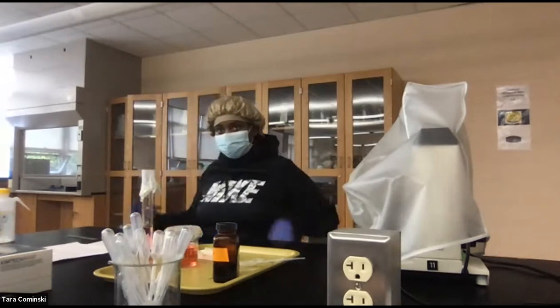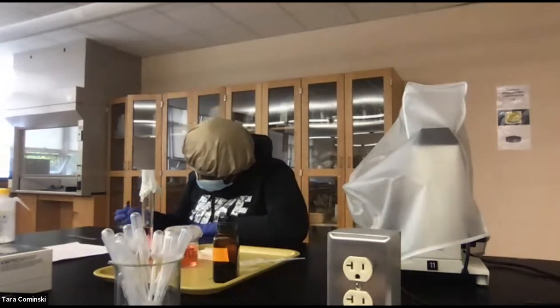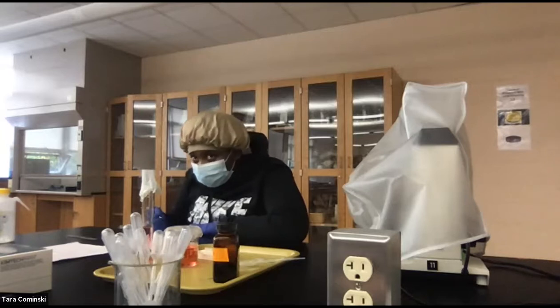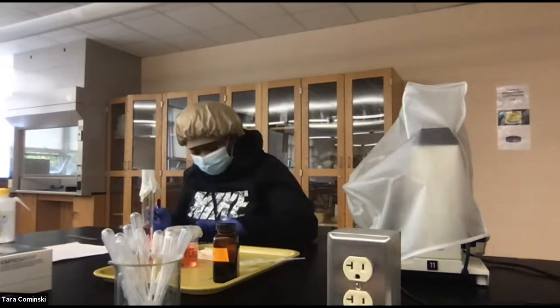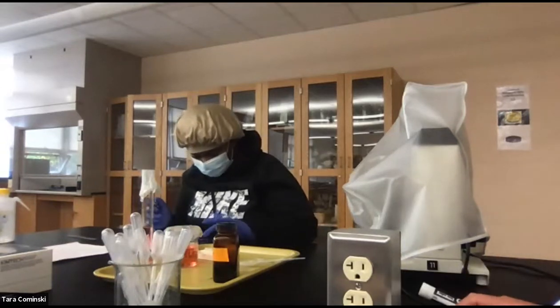This is 150, so what do you think that line is there? It's exactly halfway between 100 and 150, right? So 125 to that line. This is going 25, 50, 75, 100, 125. Oh, okay. All right, so 125 milliliters in the beaker. Do the conversion. Tell me what the answer is.